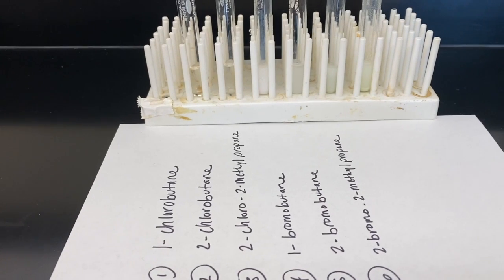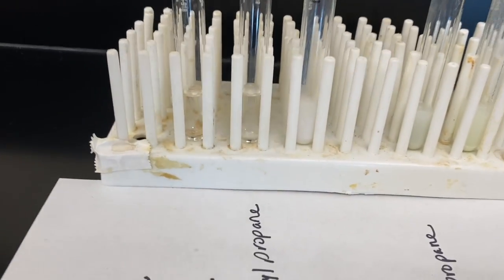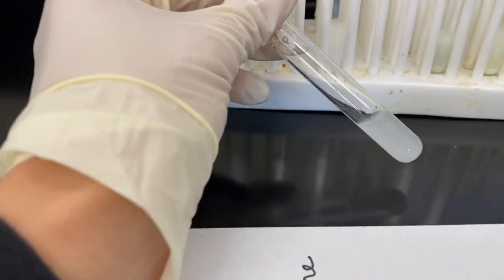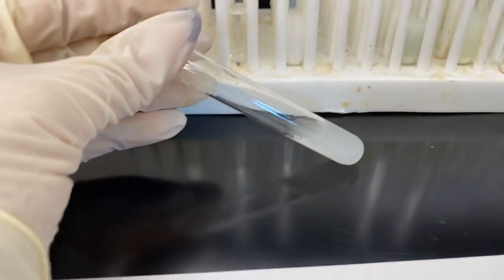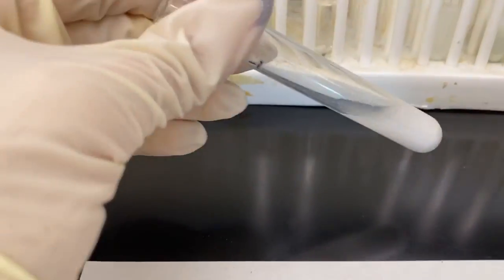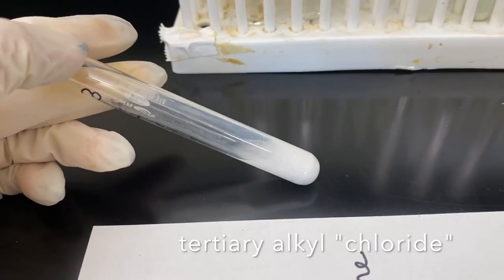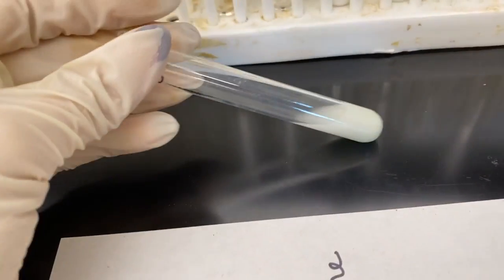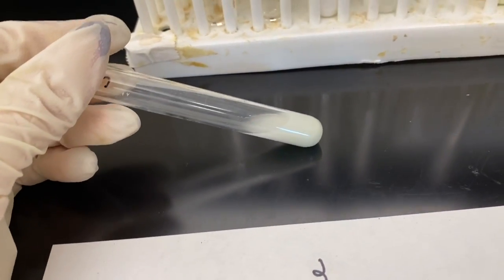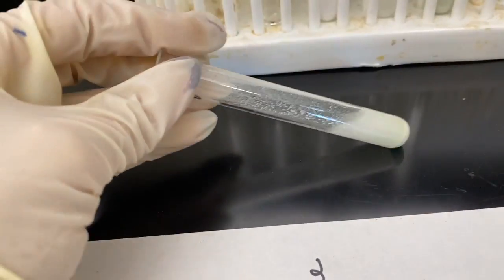And that one's a little bit interesting, huh? It typically wouldn't form a carbocation, so maybe it goes through a different pathway to react. But you see, it's definitely reacted. Maybe not as well as the others, but we definitely see some cloudiness and precipitate forming. This is number 3, our tertiary alkyl halide. Definitely a lot of precipitate in there. As we go along, think about what that precipitate could be. And remember, that is our indication that a reaction has worked.